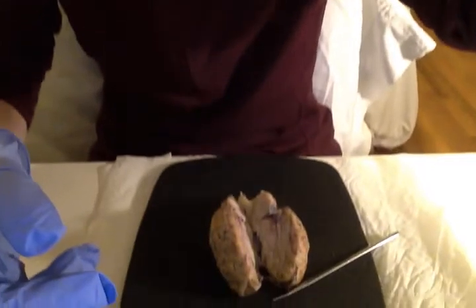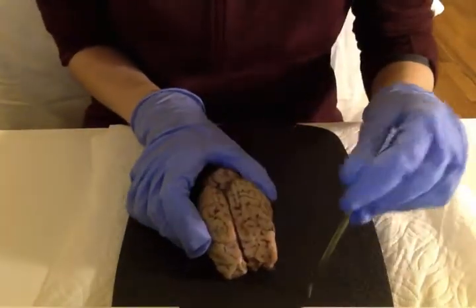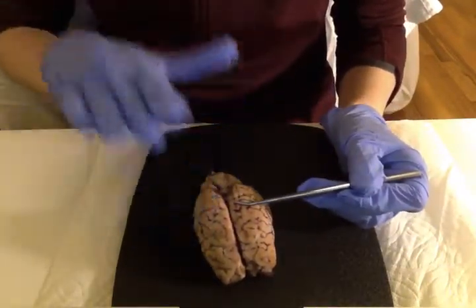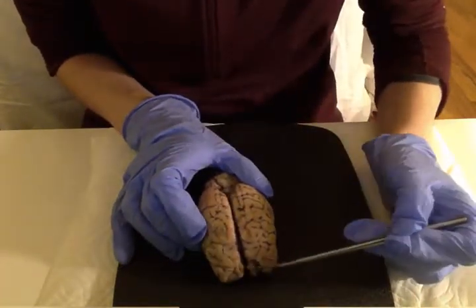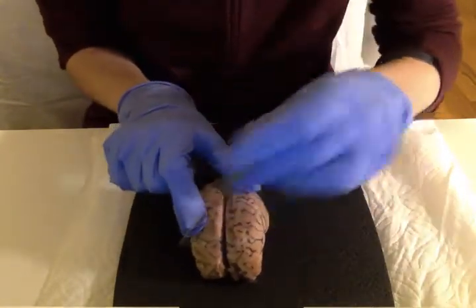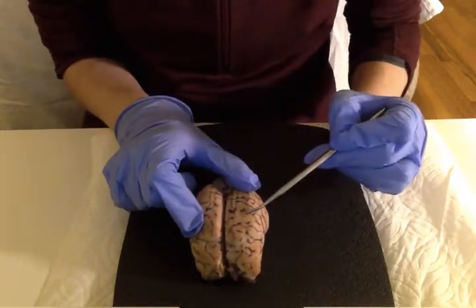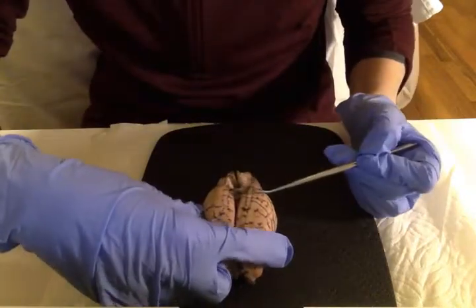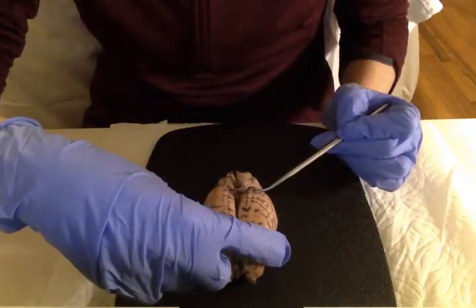So I'm going to bring this down, and I'll do my best to get as close as I can to the screen. I'm going to start on this superior view down of the brain, and I'm going to start with the lobes. First off, in the front here, we have our frontal lobes. Down on the sides, on either side, are our temporal lobes. Above that and behind the frontal lobe are our parietal lobes. And in the back of our brain, behind the parietal lobes, are the two occipital lobes. I hope you can see that.